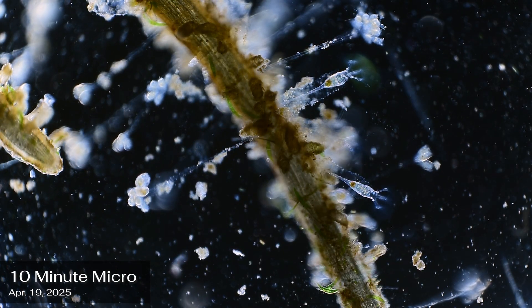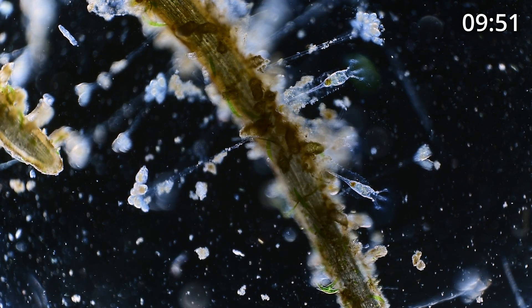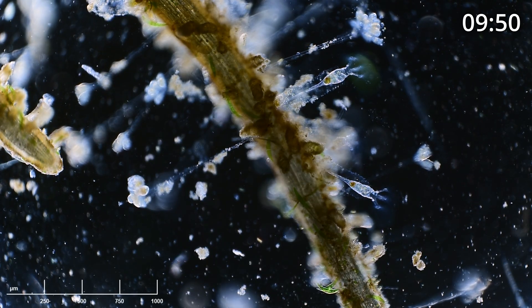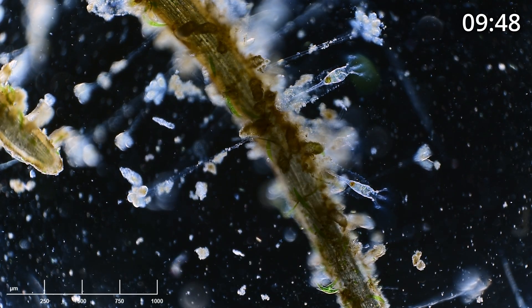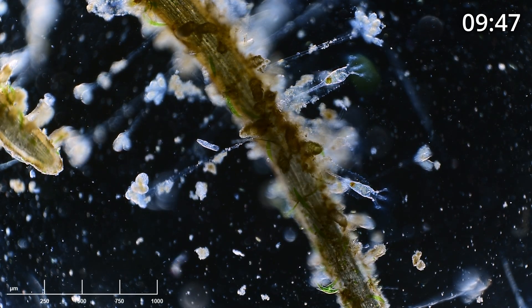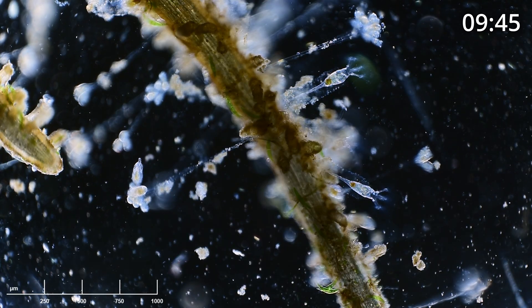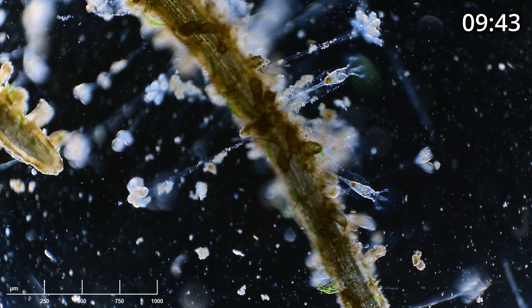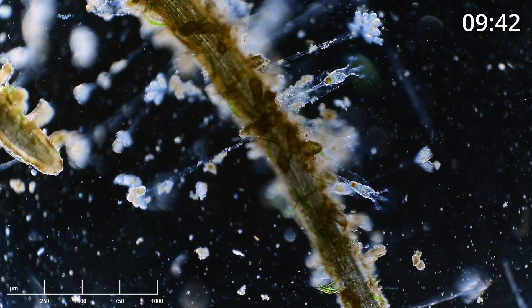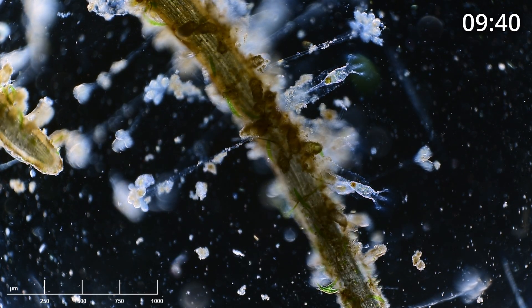Hi everyone, welcome to another 10-Minute Micro. I've put together a slide that I haven't looked at, and I'm going to spend exactly 10 minutes scanning the slide and reacting to it along with you.